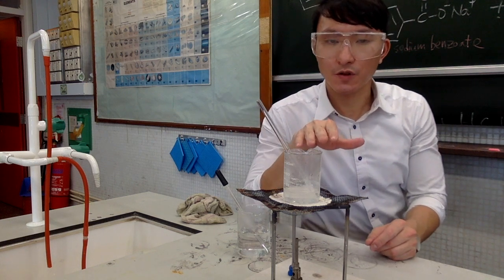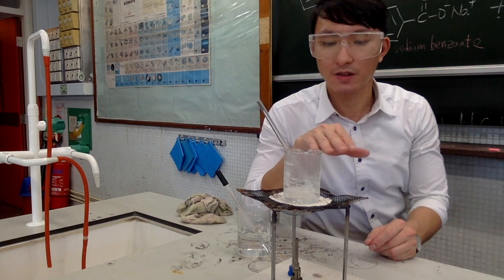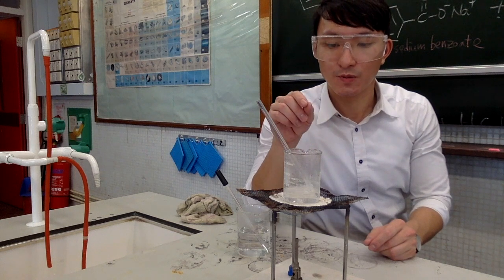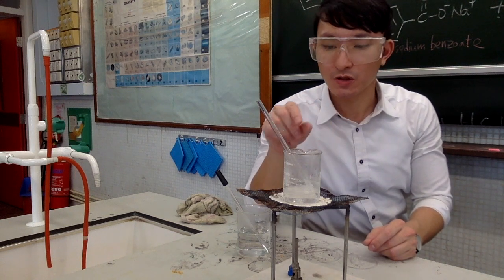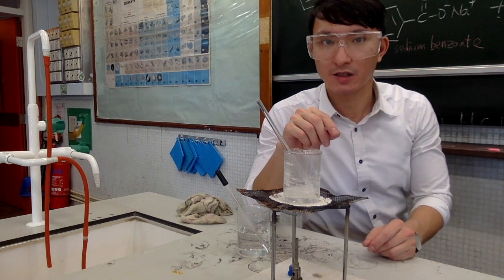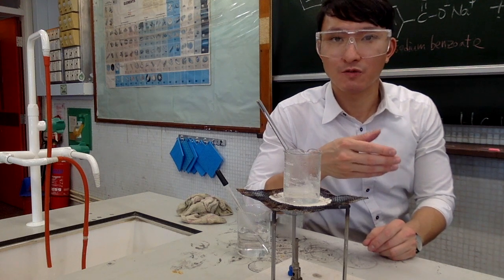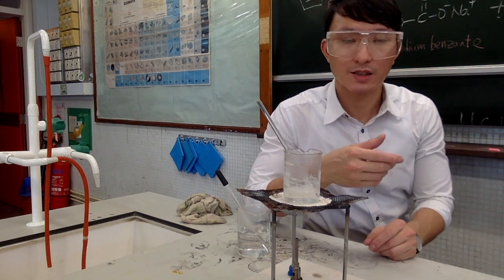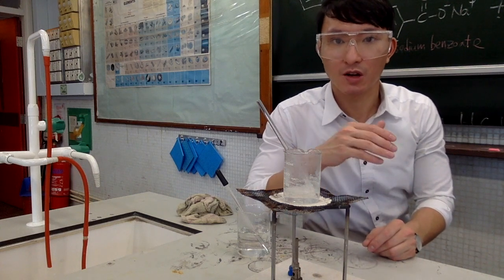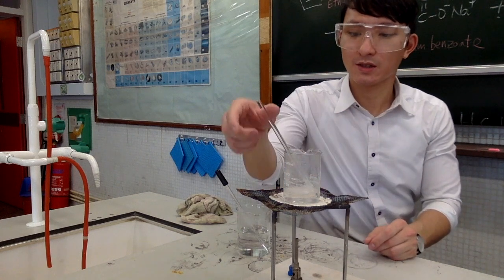At this stage, if you observe any insoluble solid that can never dissolve no matter how much you stir it, there is an option to perform a filtration while the solution is hot. This is to remove any insoluble solid impurities. However, a filtration like this will likely result in the loss of product. So it is up to you whether you want to do a filtration while the solution is hot. In this particular experiment, my advice is not to do it.